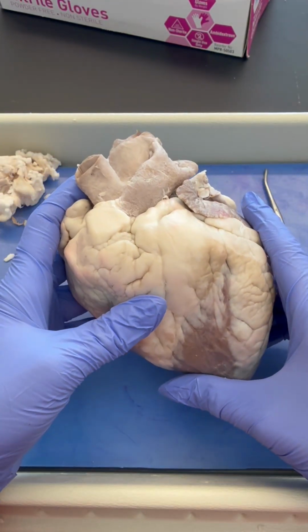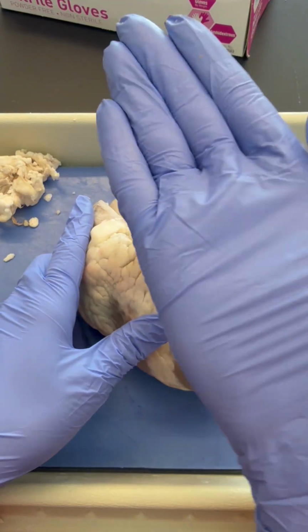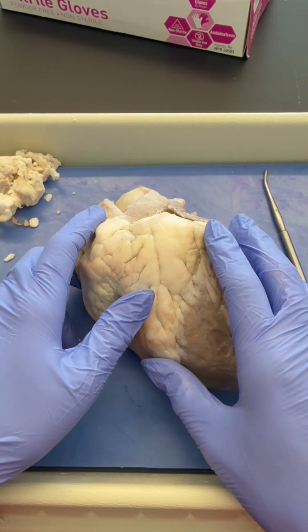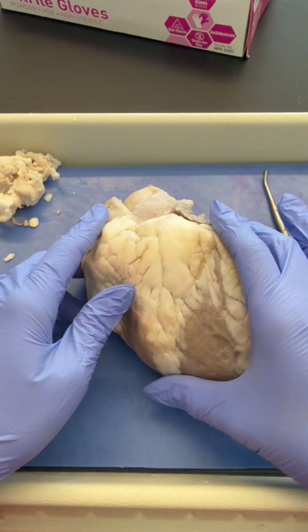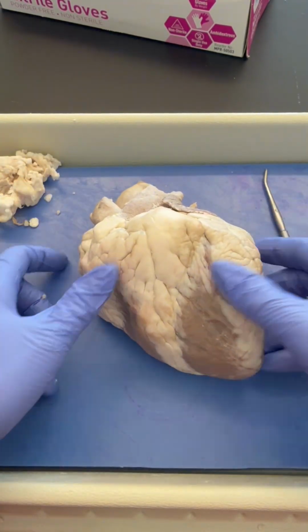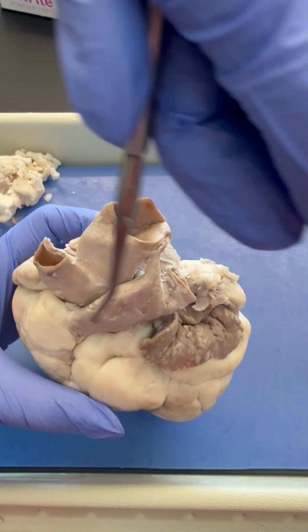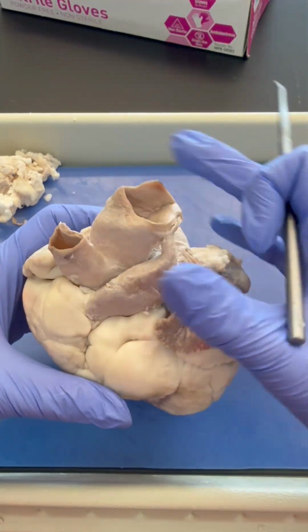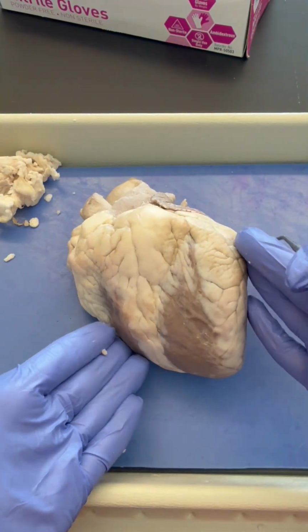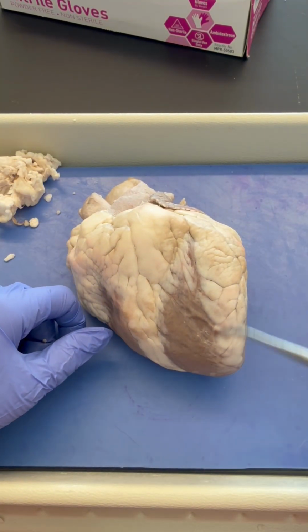The first thing that we're going to do is position the heart in the anatomical position as if the sheep is laying supine on the dissection tray. Supine meaning belly button side up, facing toward us. The reason that we know the heart is positioned like this is, first of all, the superior surface, of course, has all of the big blood vessels, and then the inferior surface has the apex of the heart, or the point down here, specifically at the left ventricle.